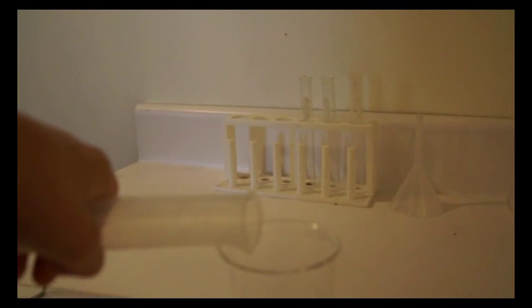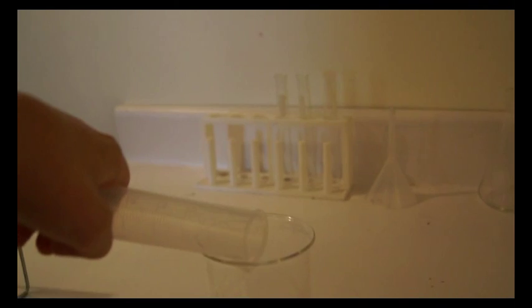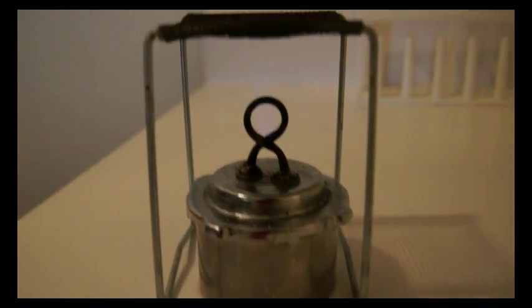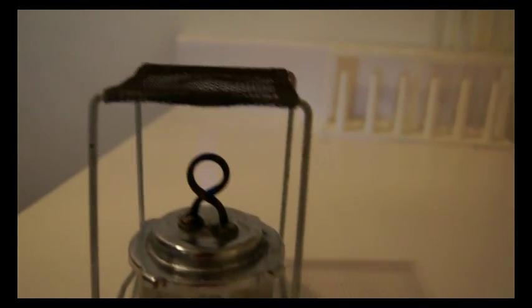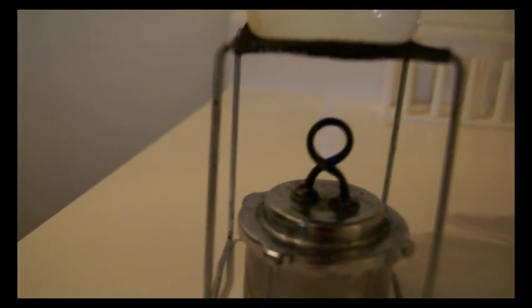What I use is 100 milliliters of it. I'm just going to transfer it from the graduated cylinder into the beaker as seen, and then I have a lit alcohol burner and I'm going to place the beaker on the alcohol burner.